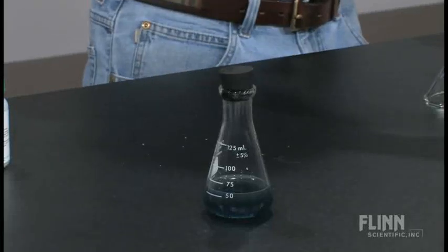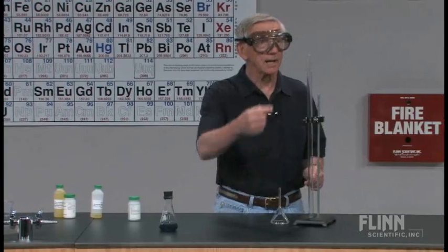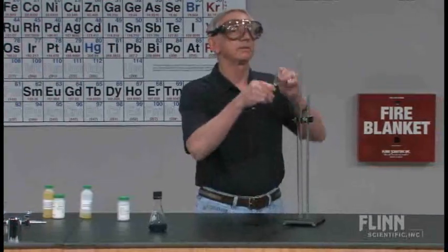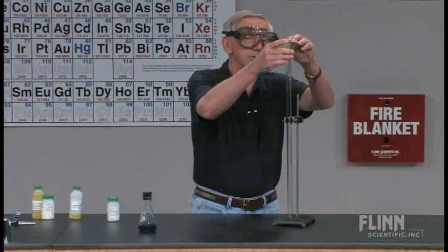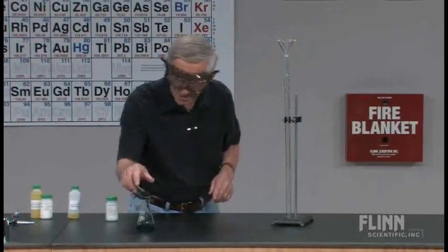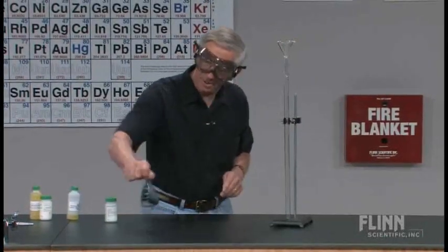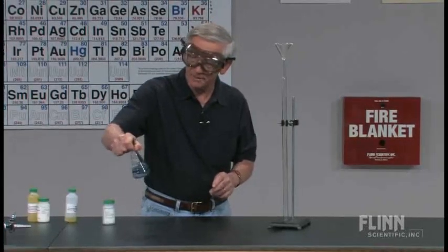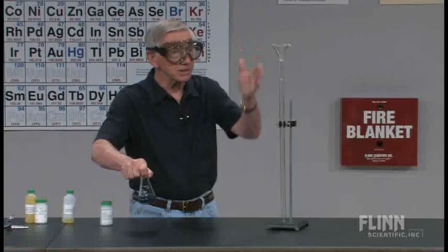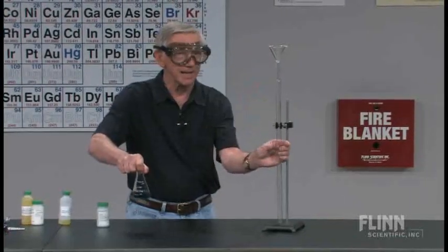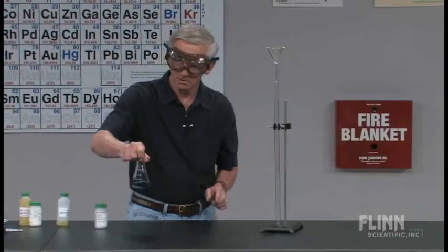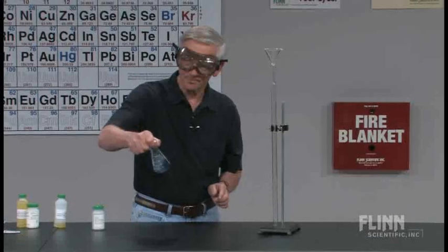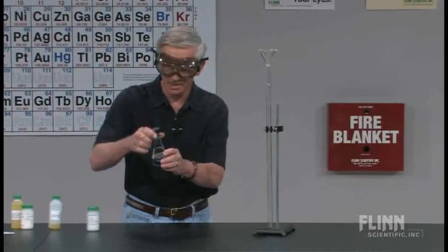What I want to do now is put some of the solution in this graduated cylinder, or this gas measuring tube. This happens to be a 100 milliliter tube. 50 milliliter tube works just as well. The one thing you do want to have is something that has a relatively large height to diameter ratio. There. I like that.